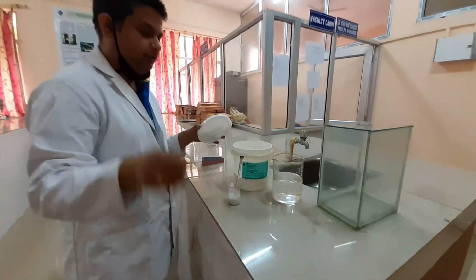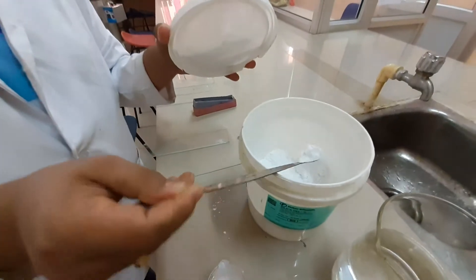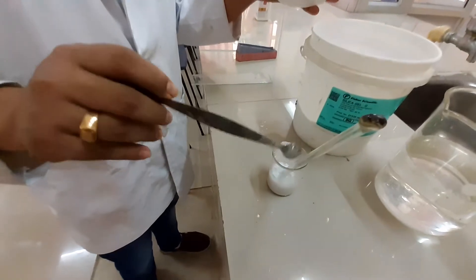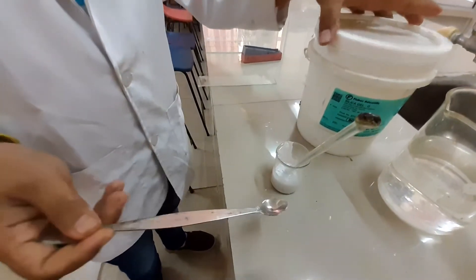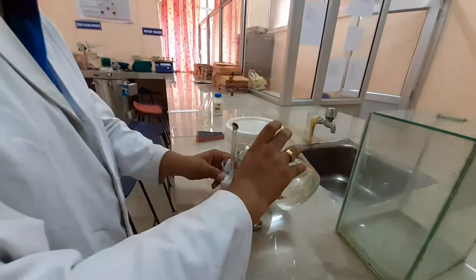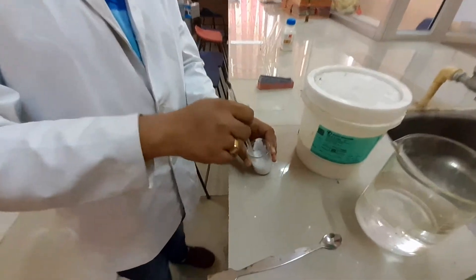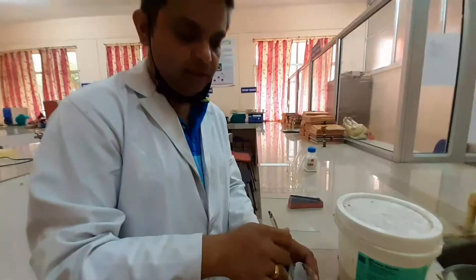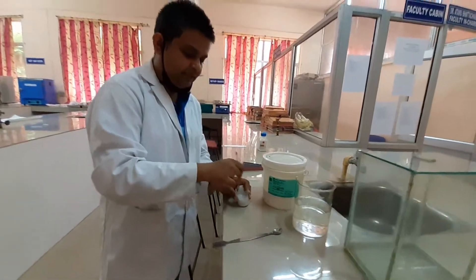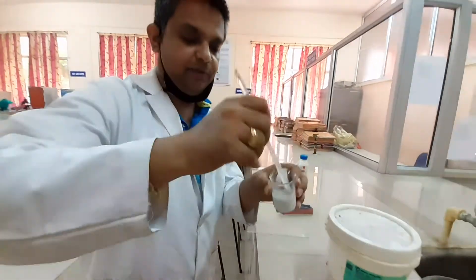This is the silica gel. A little quantity of silica gel we are pouring into either a mortar or a beaker. We are using a little quantity of distilled water. Stir it properly so that whatever air bubbles are entrapped here should get evolved. After mixing it properly, you can prepare a slurry — you can see here the slurry we have prepared.